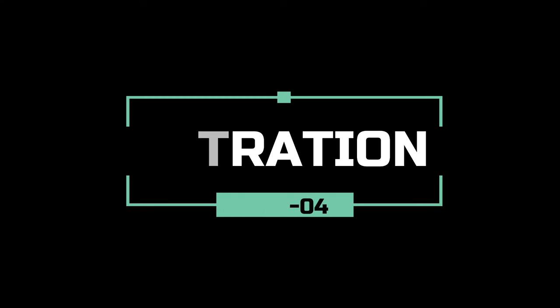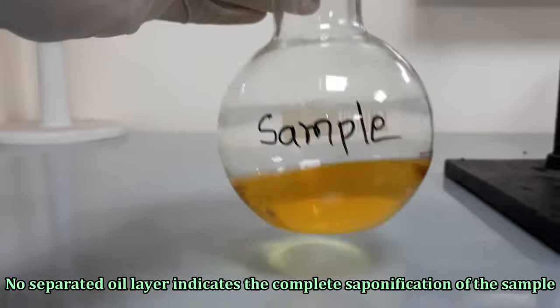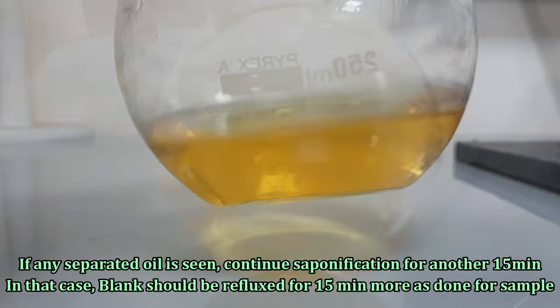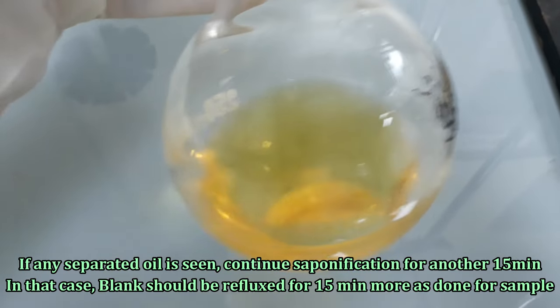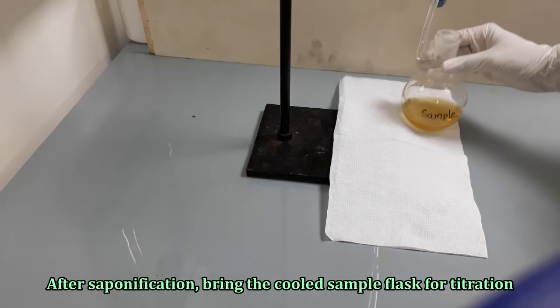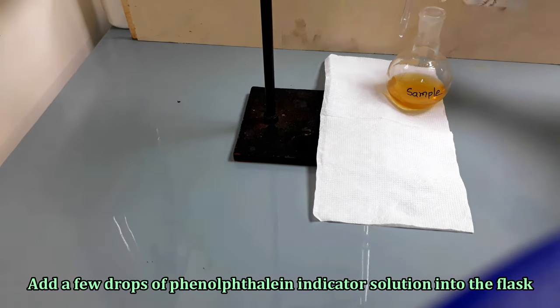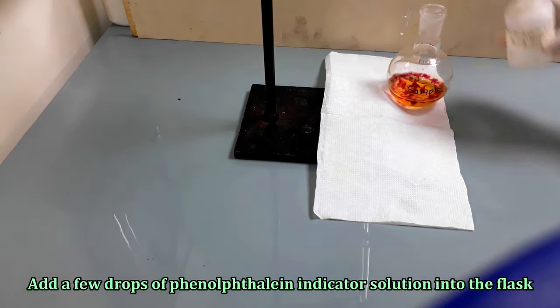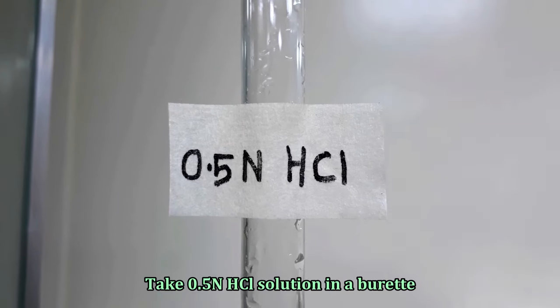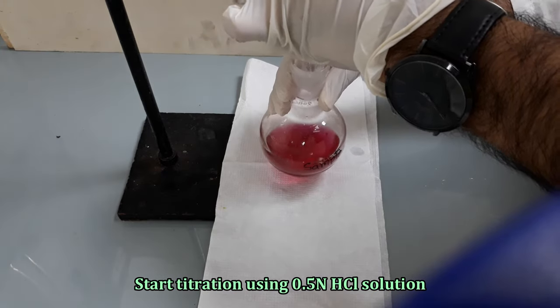It's time for the titration. At first, we will titrate our saponified sample. Check the sample flask for a separated oil layer carefully. No separated oil layer indicates the complete saponification of the sample. If any separated oil is seen, continue the saponification for another 15 minutes — in that case, the blank should also be refluxed for 15 more minutes. After saponification, bring the cooled sample flask for titration. Add a few drops of phenolphthalein indicator solution into the flask and shake for proper mixing. Take 0.5 normal hydrochloric acid solution in a burette and note the initial burette reading. Start titration with vigorous agitation of the flask.